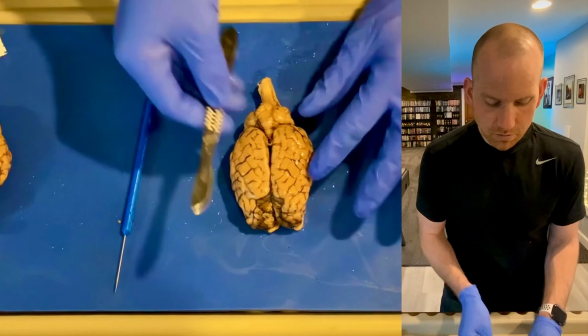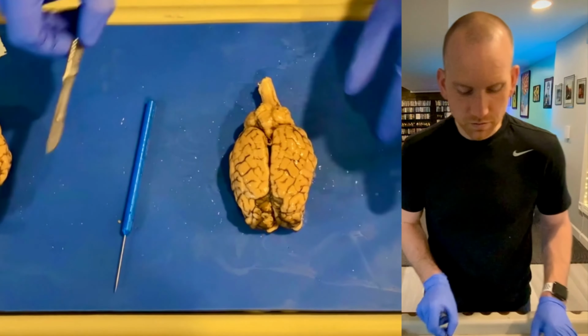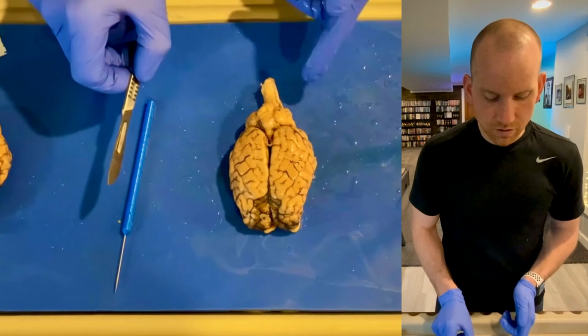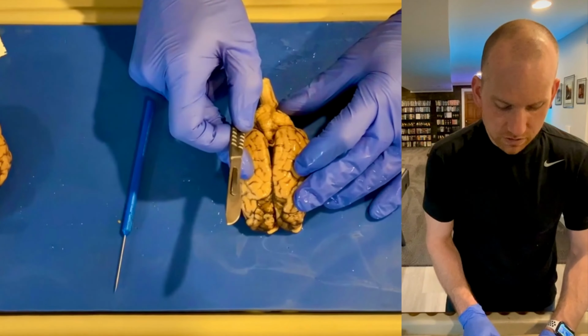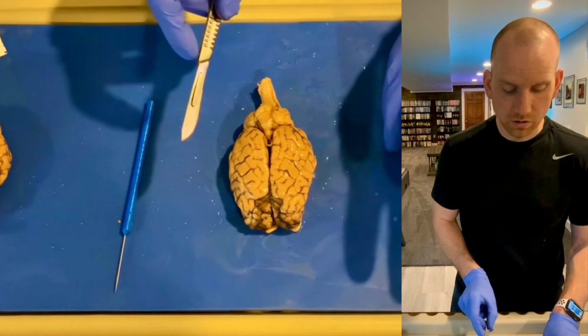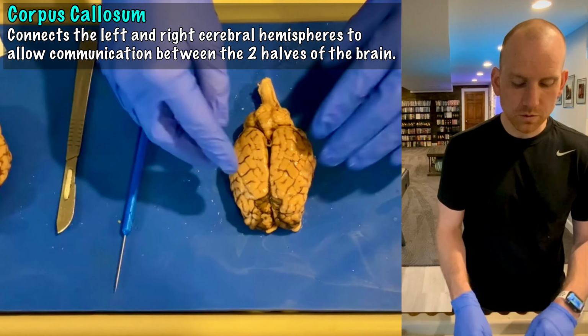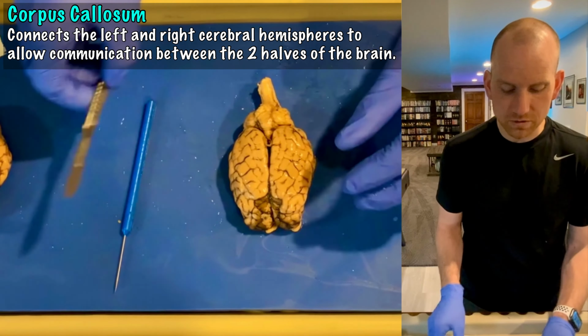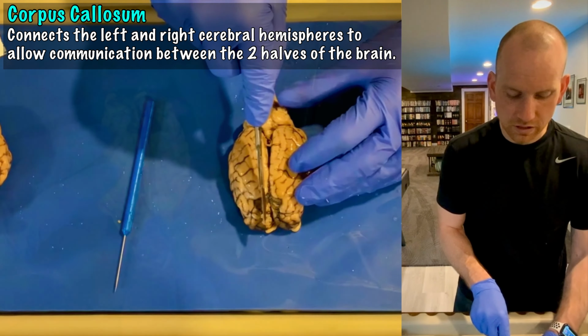So I am now going to make a mid-sagittal cut. Since we've identified everything on the superior and inferior view of our brain, I want to look mid-sagittally now. So we're just going to separate the 2 hemispheres, and we're going to cut through something called the corpus callosum. The corpus callosum is nervous tissue that connects both of the hemispheres and allows both sides of your brain to communicate with one another.